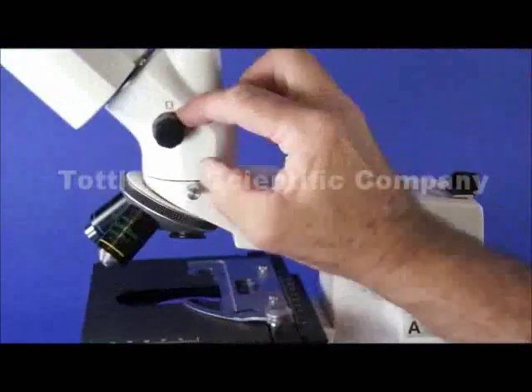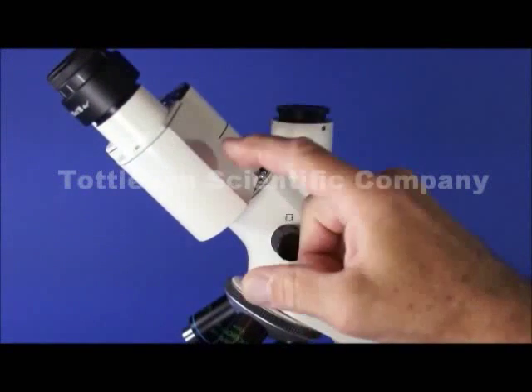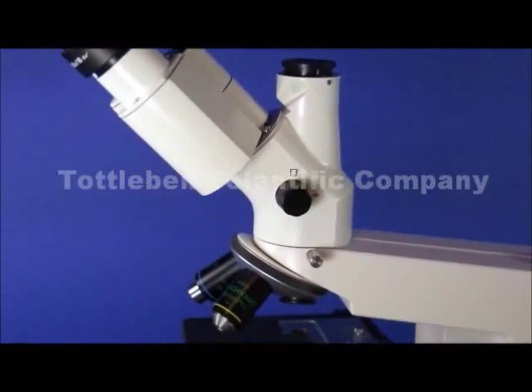On the top here you have the knob for directing the light both to the eyepieces and also for the camera.